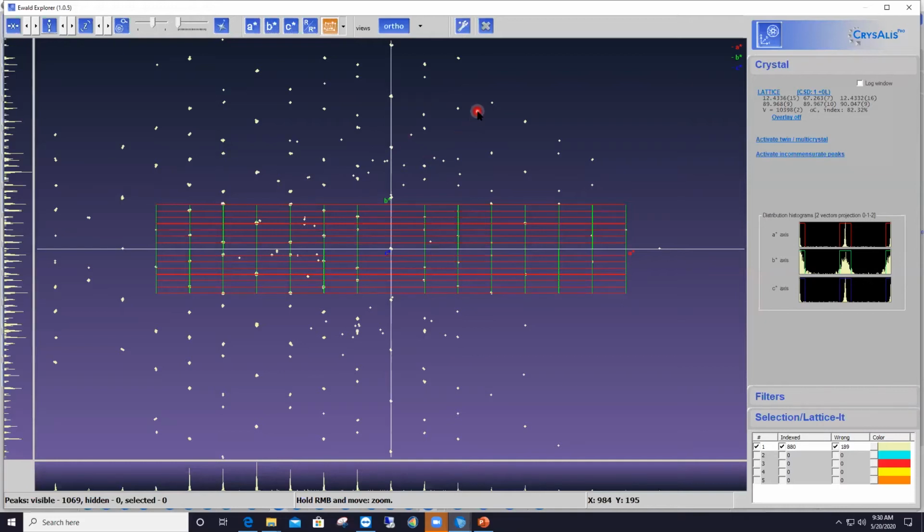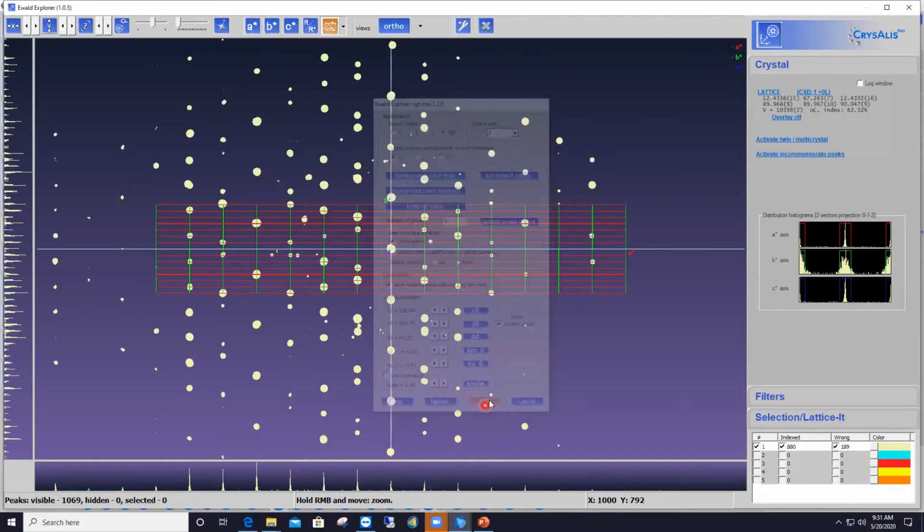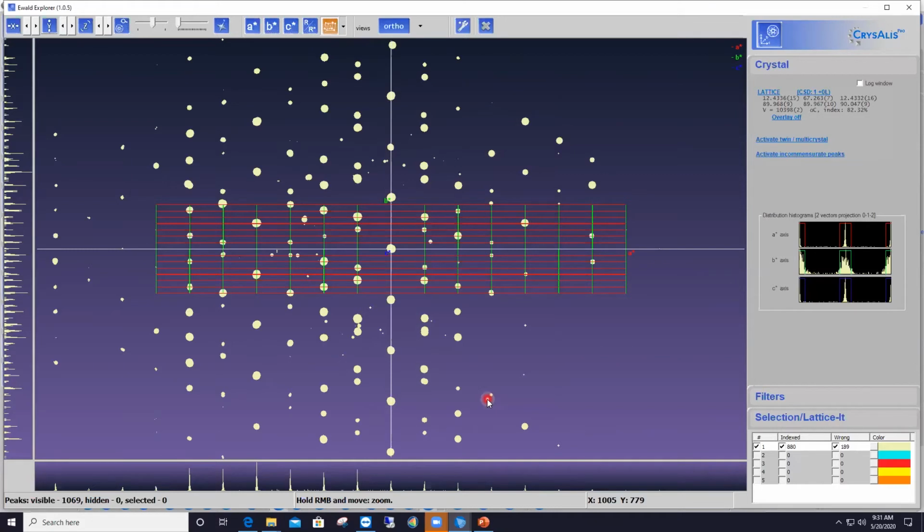To increase the size of the reflections, I go to another button at the top of the interface, the one that has a wrench and says GUI settings. So I click on it and select F of I. That will allow me to display the reflections according to their intensity. And now the size of those circles is proportional to the intensity of the reflections.